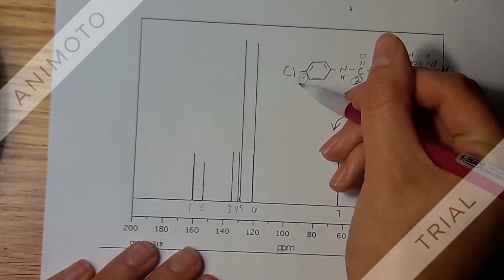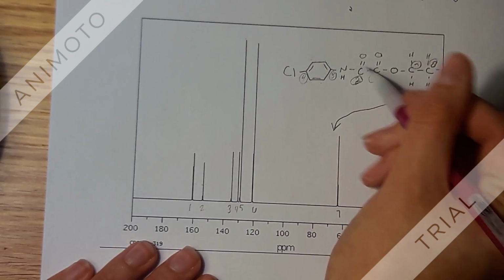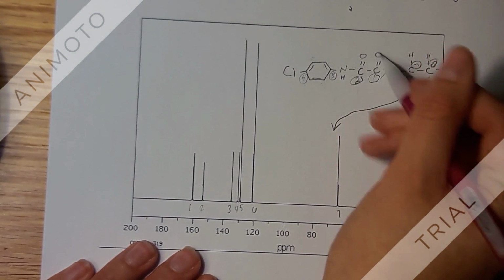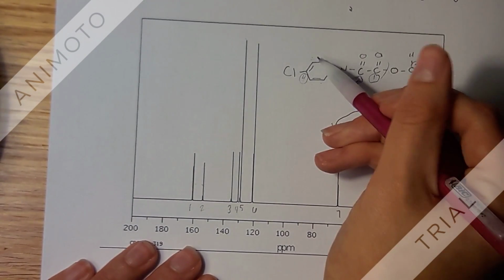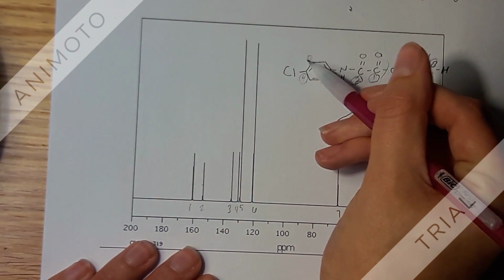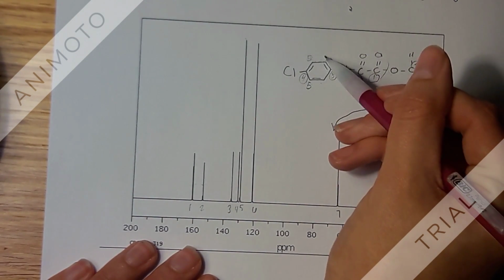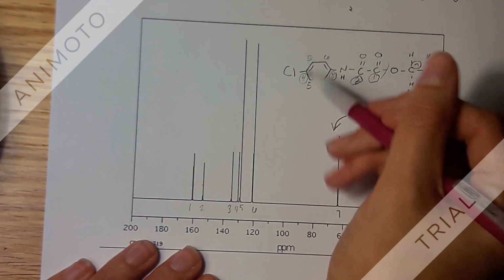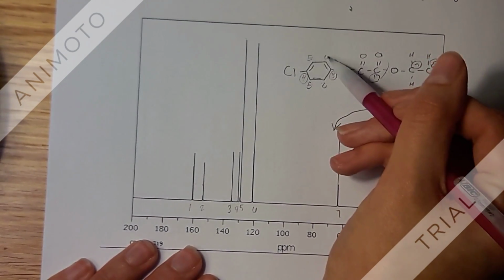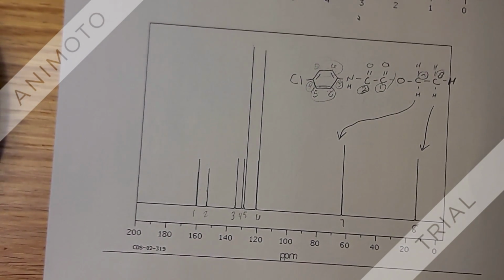the integration of 4, which is right here, and this one's going to get the integration of 3 because it's a little bit closer to these oxygen over here. And then finally, these ones are going to have 5 and 6 respectively. So these two are going to have 5, these two are going to have 6, and it's really kind of unknown which ones are which in here. So which is why they both get the assignment of 5 and 6.